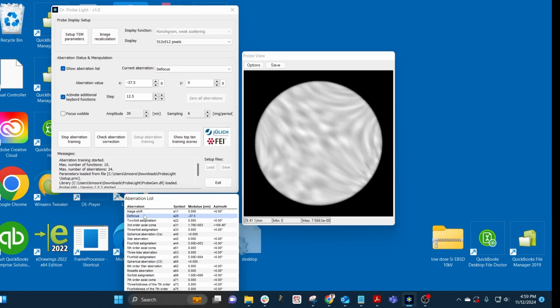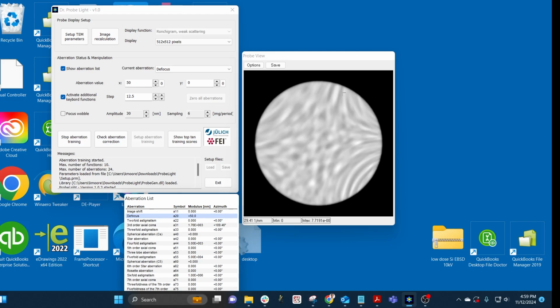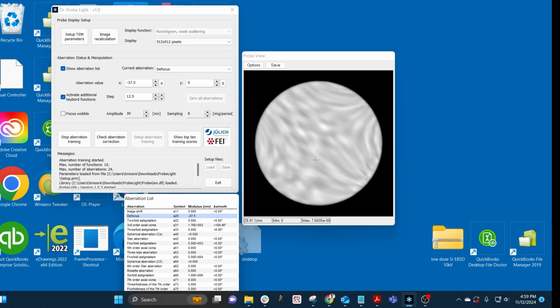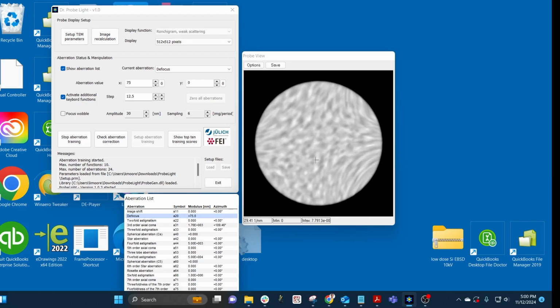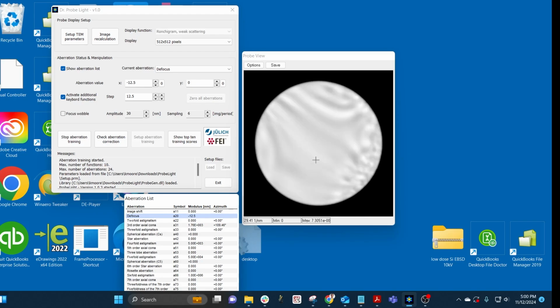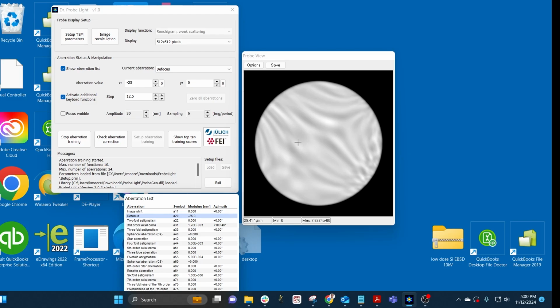What I do see is that stretching, top left to bottom right, and then as I go through focus, maybe top right to bottom left. That stretching is the twofold astigmatism, basically your condenser. So I'm going to go to where I can see it, pretty close to focus here, and I'm going to switch from focus and coma into twofold astigmatism. I'll drop the step size down a bit.